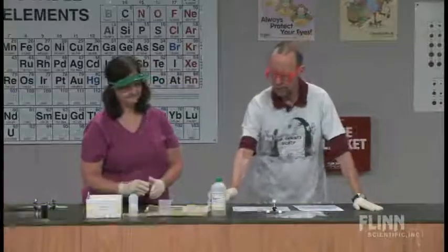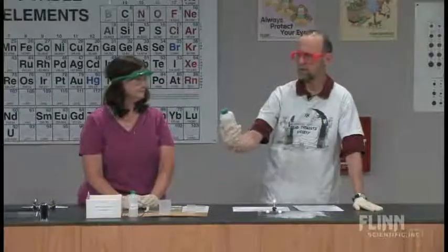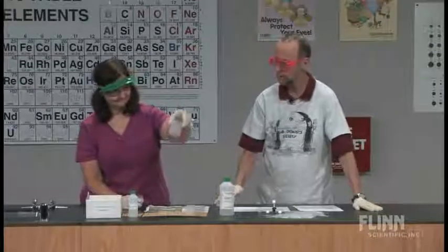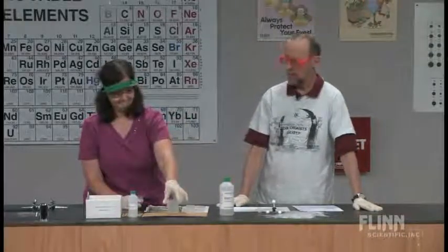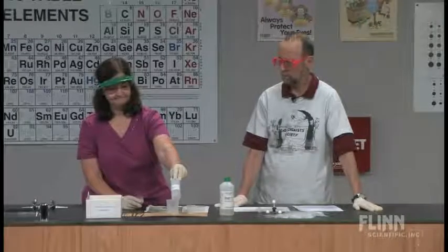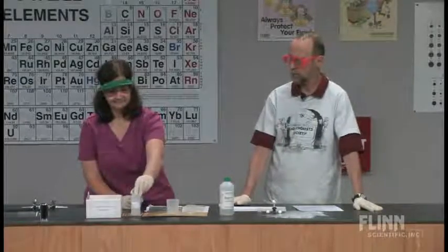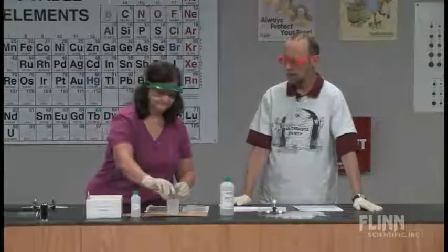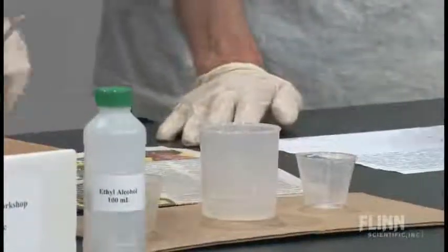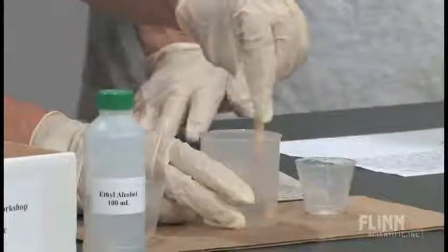A little bit on polymers — we're going to make one of our own polymers here. We're going to start out with what we have here: sodium silicate solution, and you've put 20 milliliters in there. And then you've got about 5 milliliters of ethyl alcohol, and we're going to mix those two right now. While she's mixing it, I'm going to talk a little bit about that.